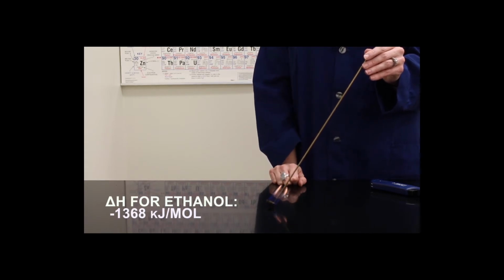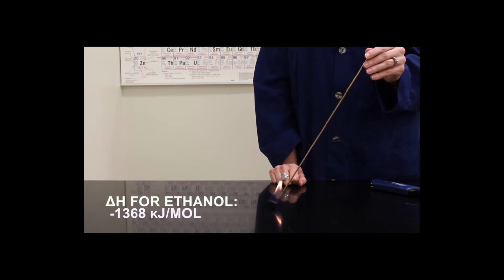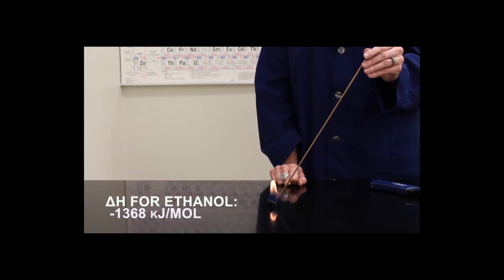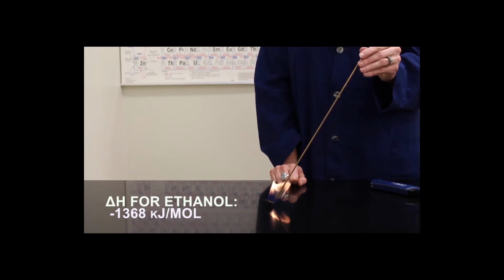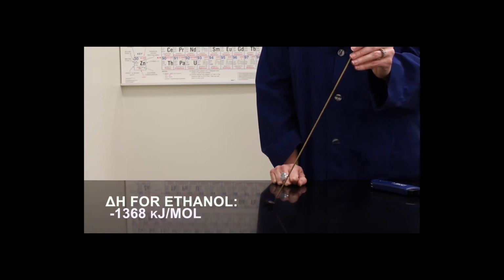The fact that ethanol is blue implies that it is a clean burning fuel source. This is one of the reasons why ethanol is often added to gasoline, especially in the wintertime, to help with pollution.